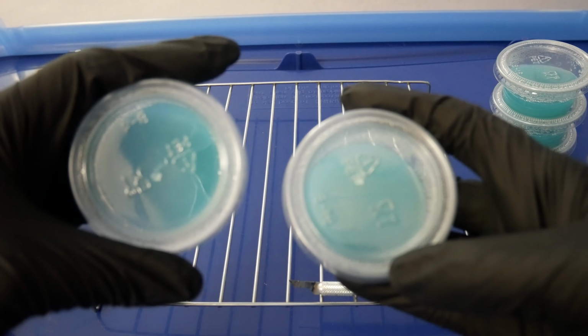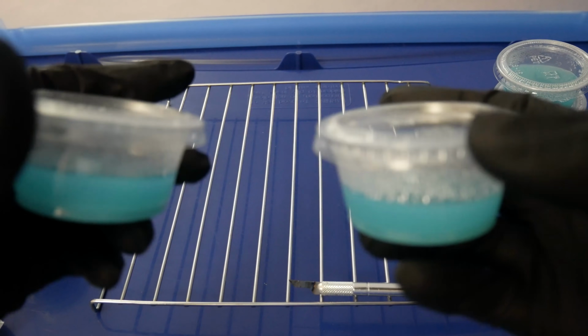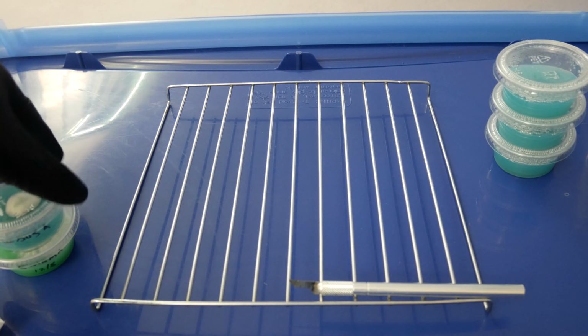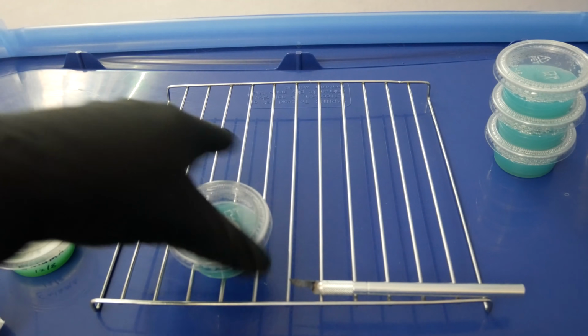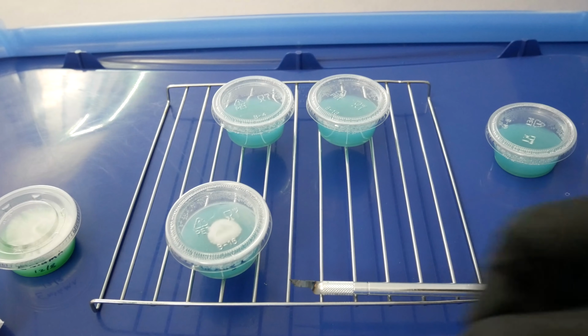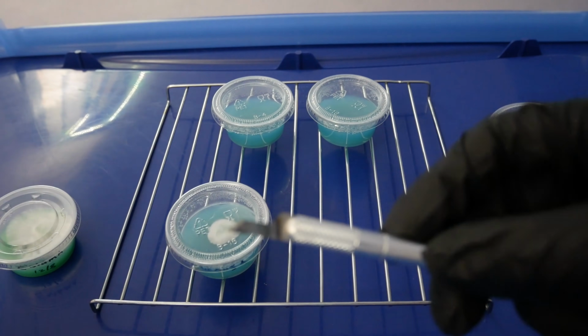Here's a look at the transfers in the new dishes. I'll put these away to store at room temperature and let them colonize for another week or two, and I'll check up on them again to see if there's any contamination. If there's contamination, we'll repeat the process and clean it up again. And if not, then they'll be ready to use for inoculating grains.